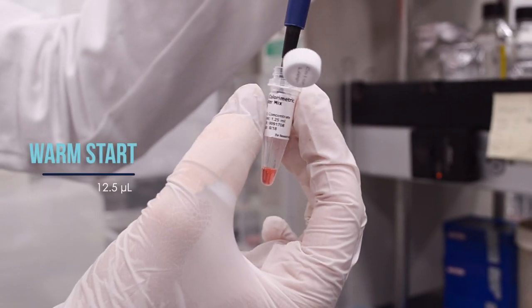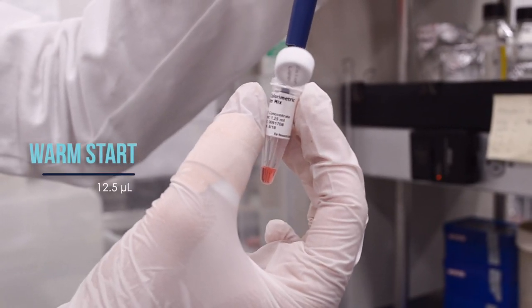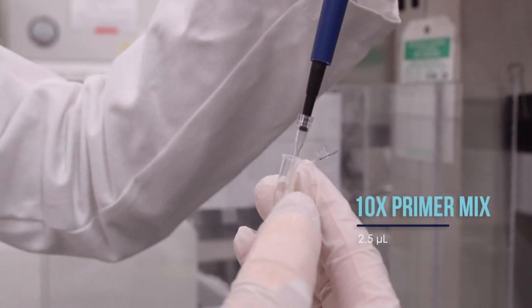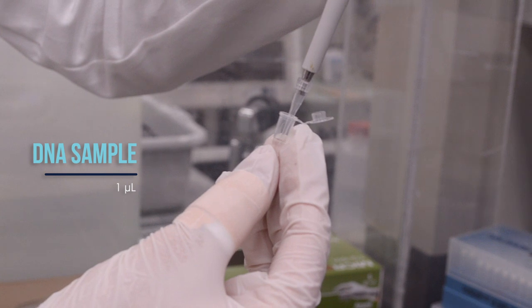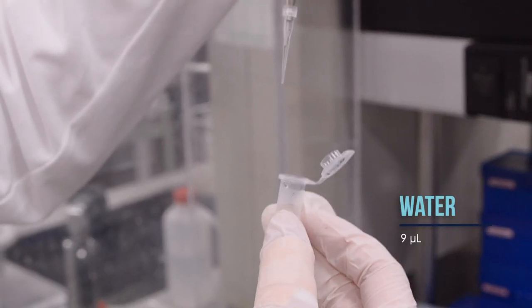For each sample, we are going to add 12.5 microliters of Warm Start, 2.5 microliters of the 10X primer mix, 1 microliter of the DNA sample, and 9 microliters of water.